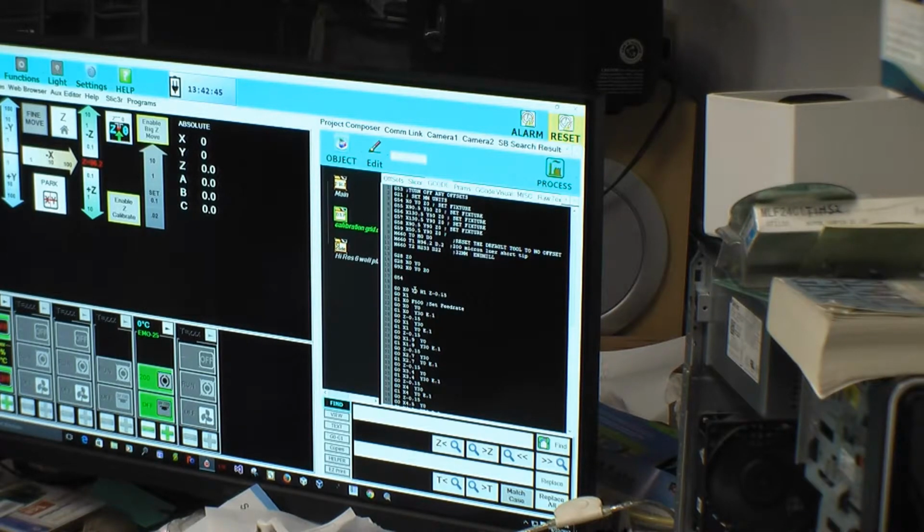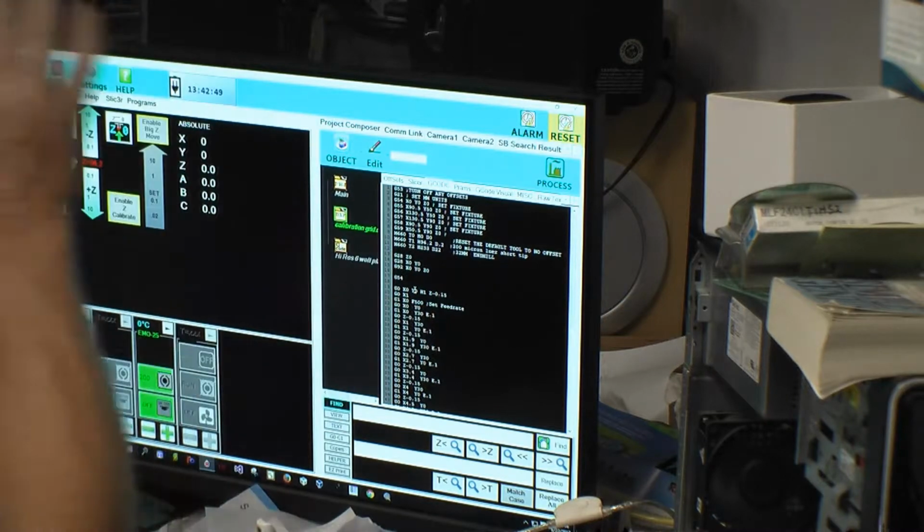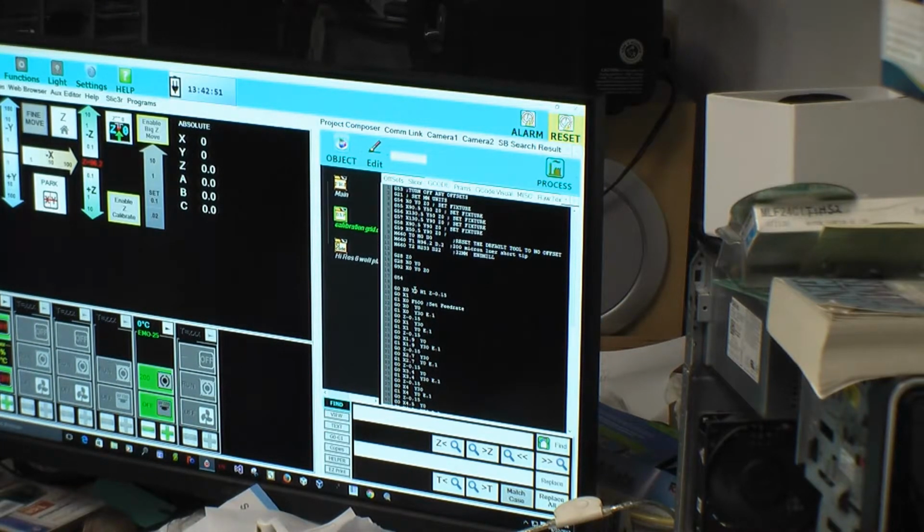So why isn't this H3 or 4 or whatever? Because I assigned it here. I told it T1. I did that. I can just as easily go like this. I'll make it T. I'm going to copy this line. And you're right, that's good practice. It's a very good question. It's a very good point.